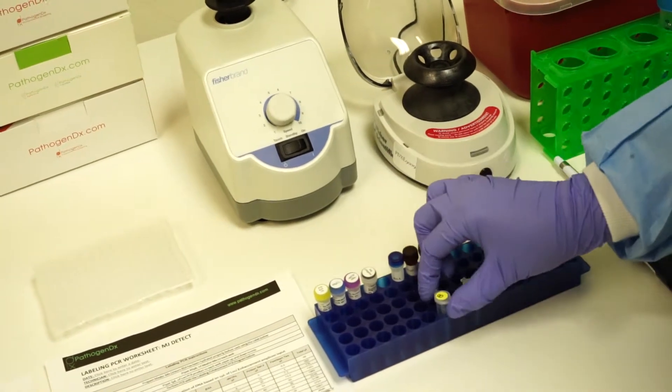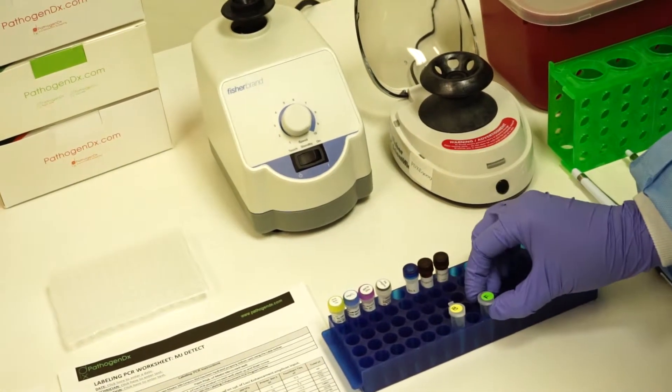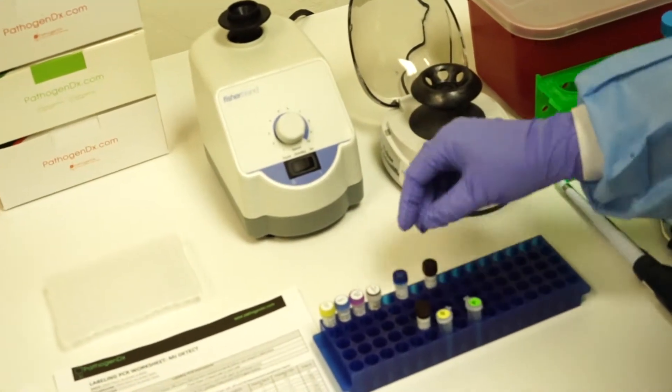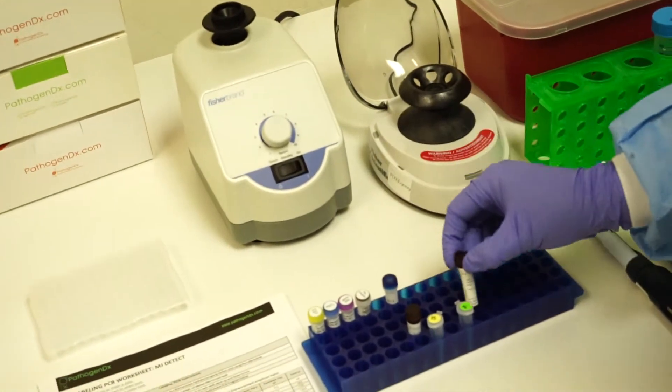For each of these, you will make one master mix for bacteria and one for fungal. Ensure that the appropriate primer set is used for bacteria and the appropriate primer set is used for fungal.